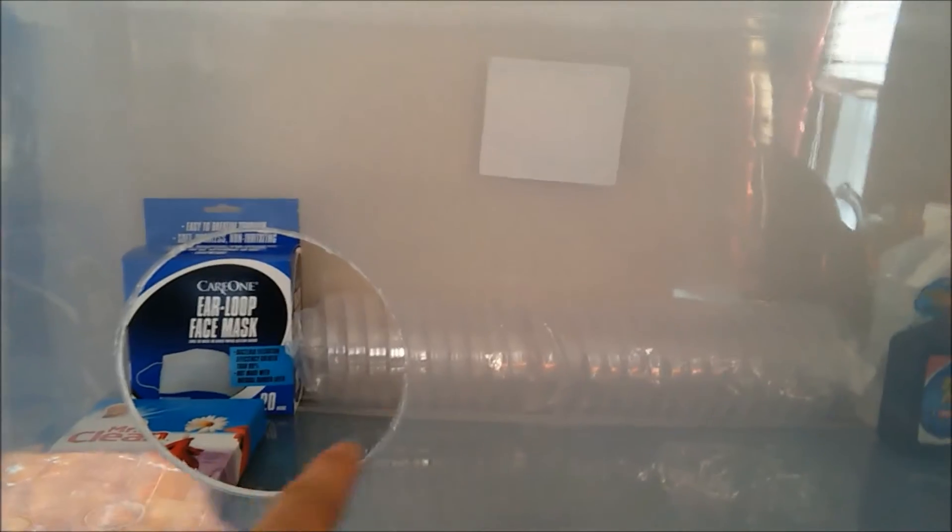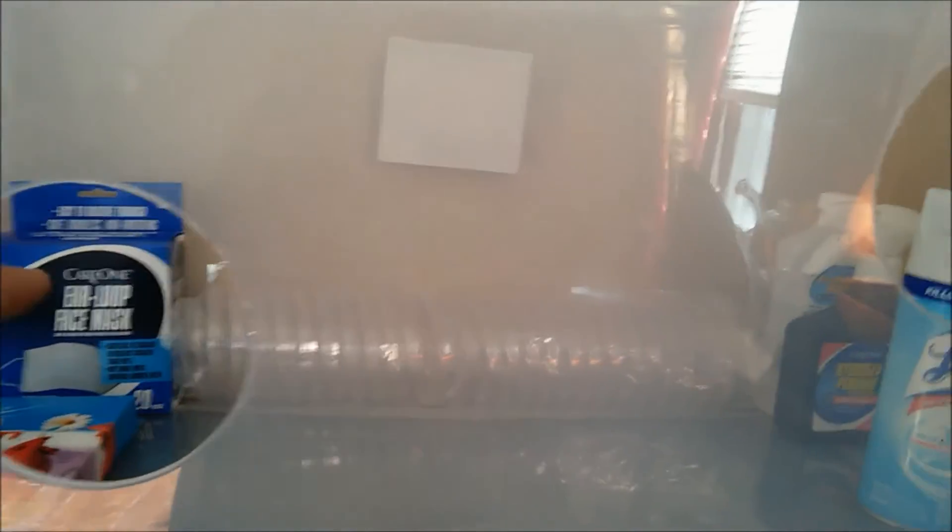There's a glove box — simple enough, right? You could get a little bit more advanced and put one of those little PVC rings in there, and you could put one of the stoppers in and close it every time you're not using it, and you can also attach your gloves to it. But what we're going to do is we're just going to use our gloves whenever we use it.